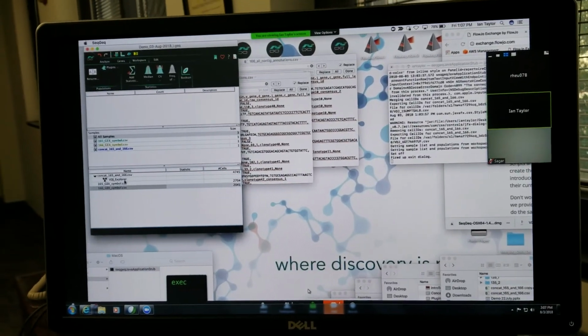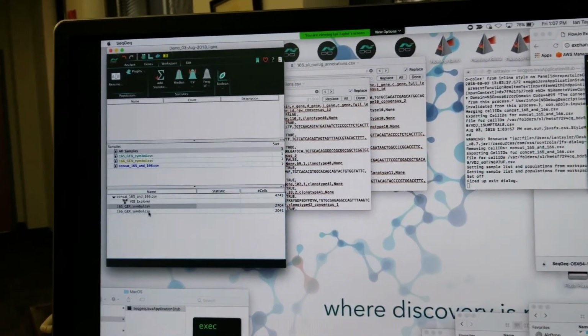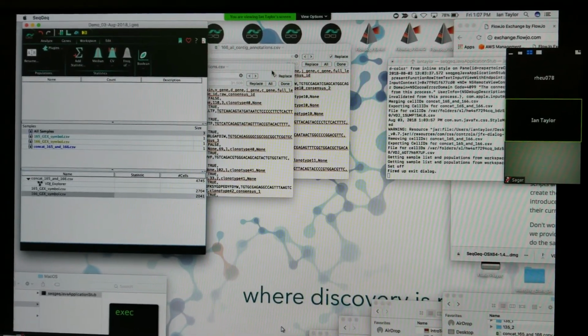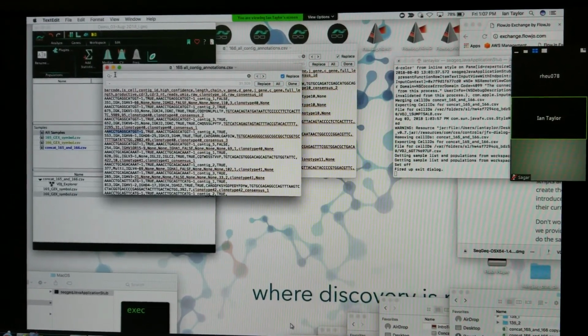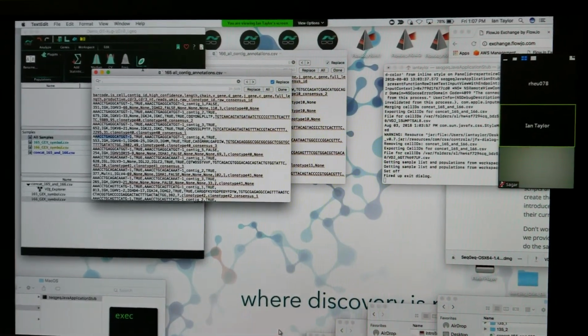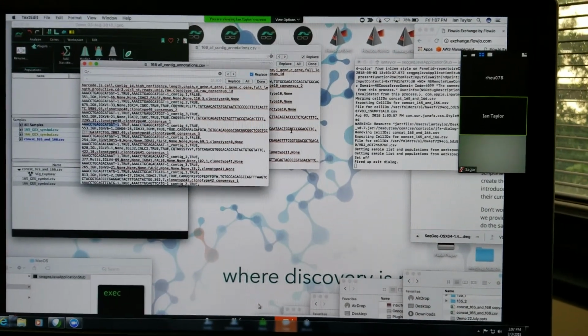In this case, we have two gene expression files, 165 and 166. But currently, it looks like the barcodes there aren't matching. So I've been doing some search replace, swapping out dots with dashes. I think we talked about this at the last meeting we had with Tim.